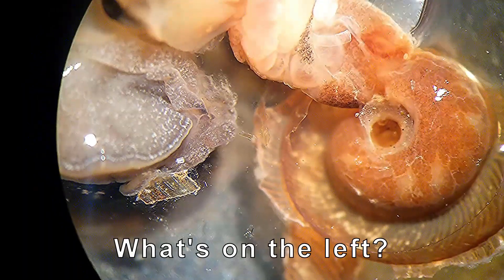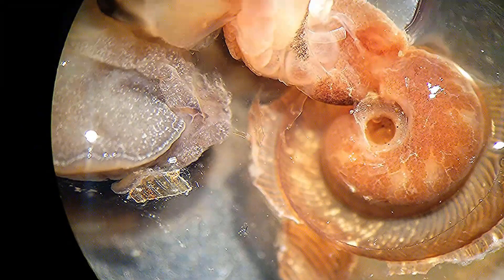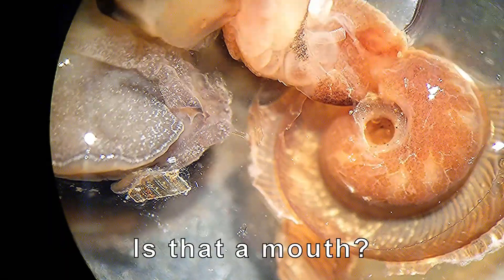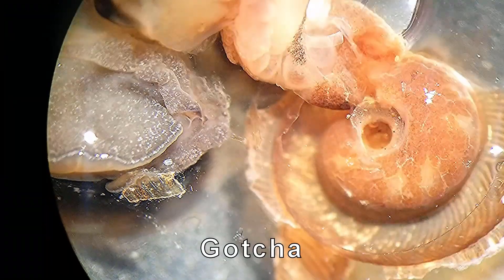So what am I looking at? What's on the left, is that the foot? What's opening and closing, is that a mouth? I think it's the mouth, yeah. And then we're going to try to take the radula out. Gotcha, okay.